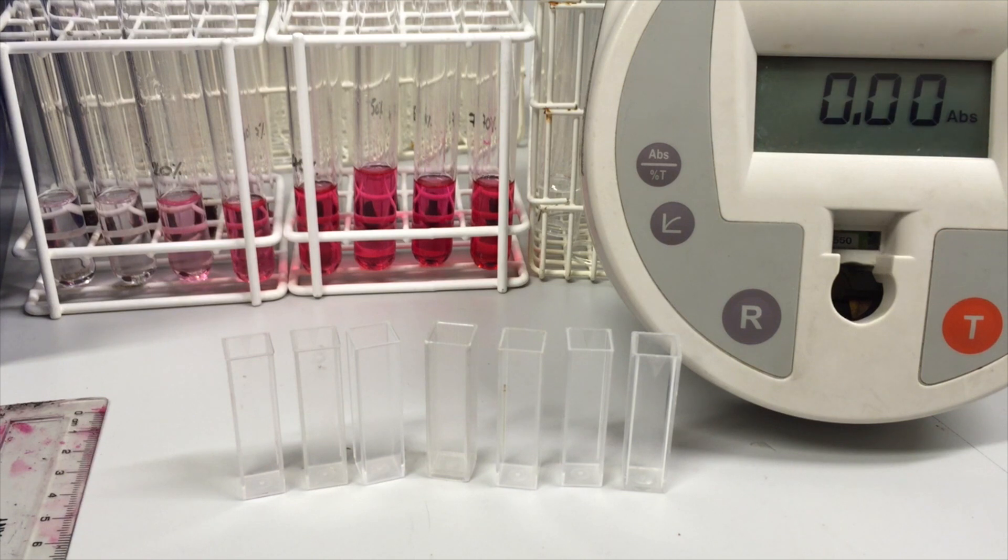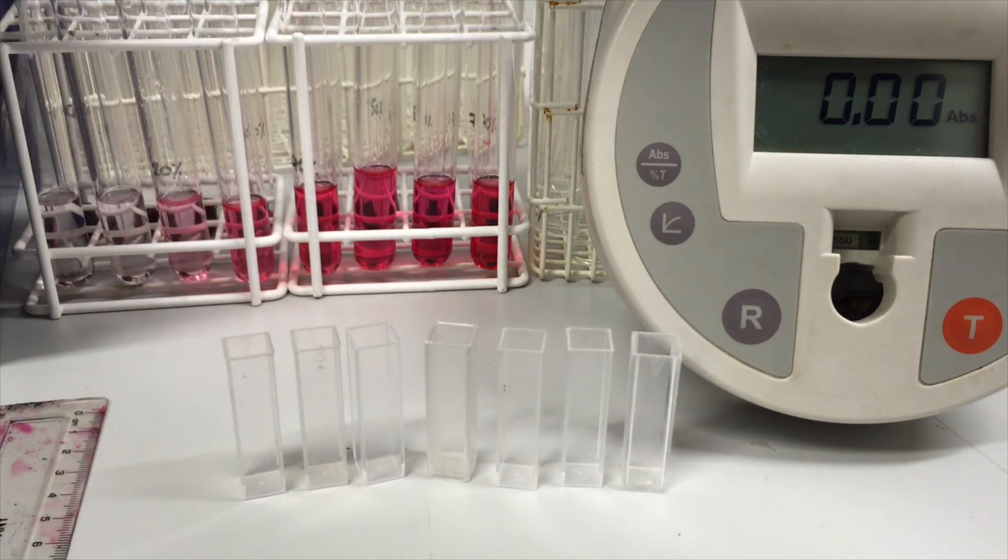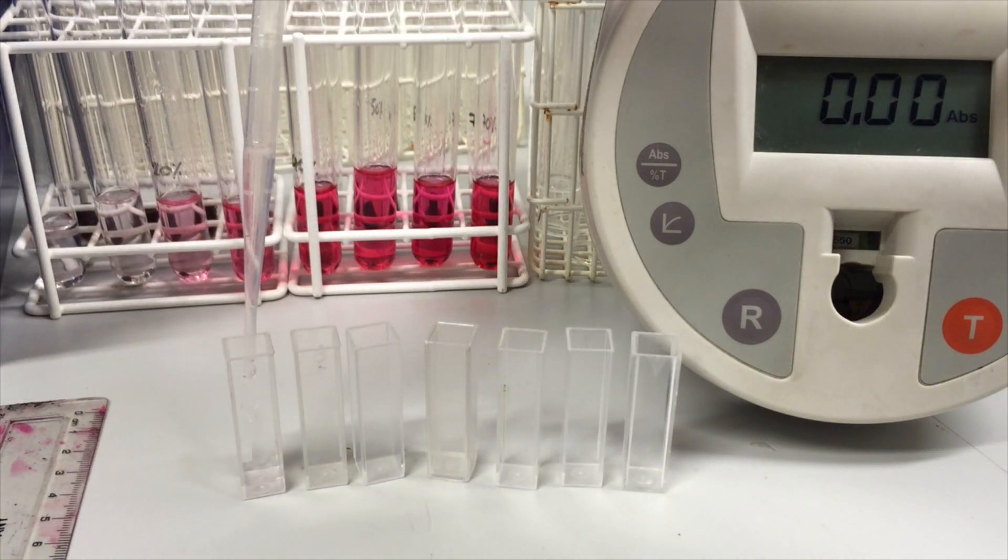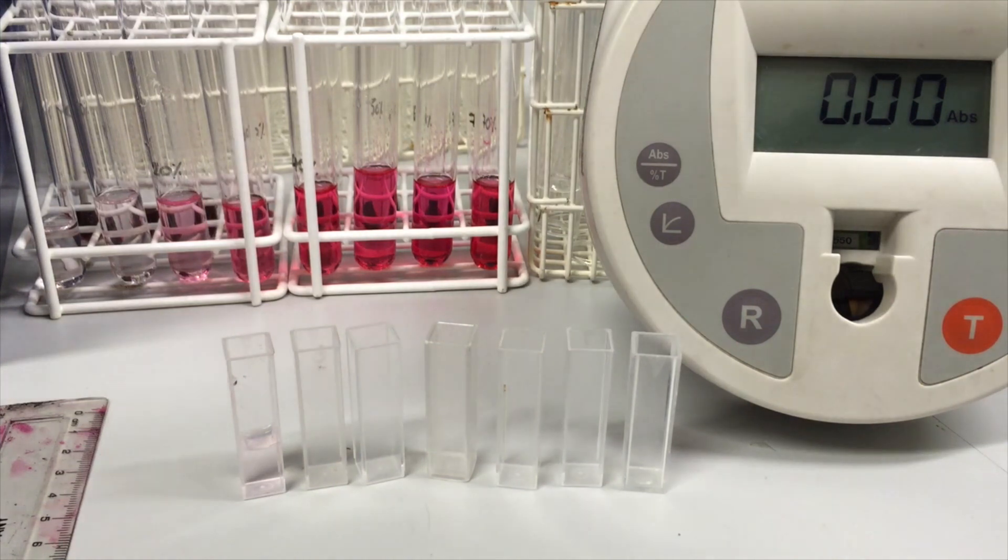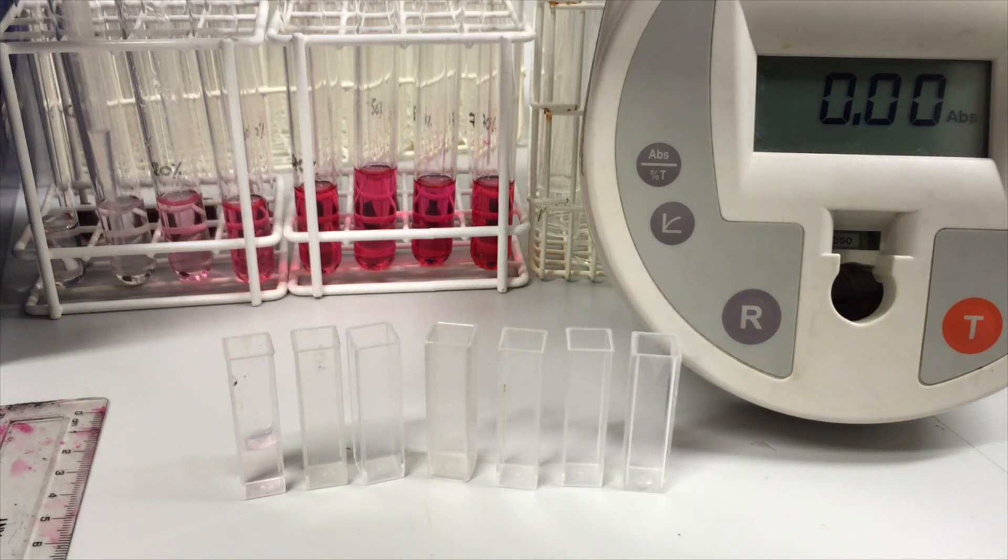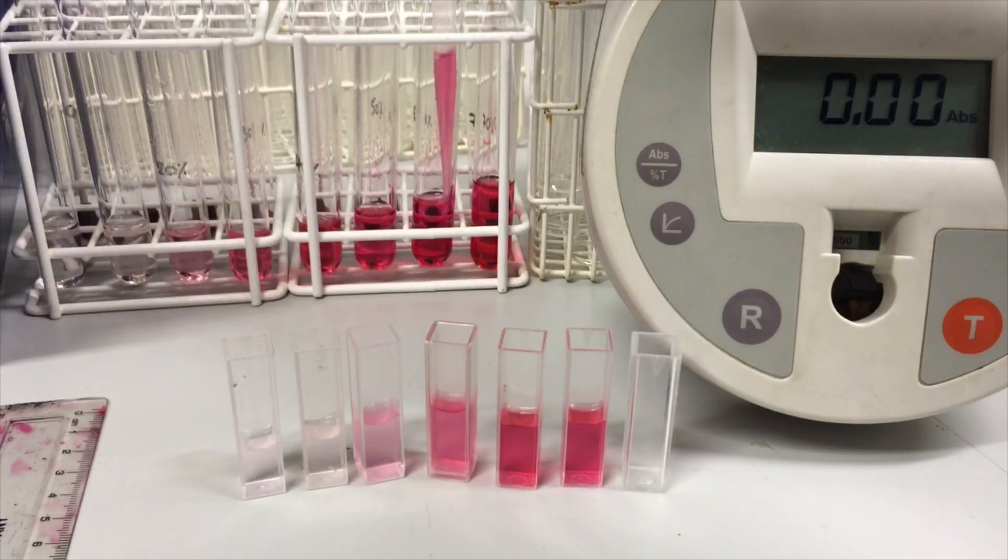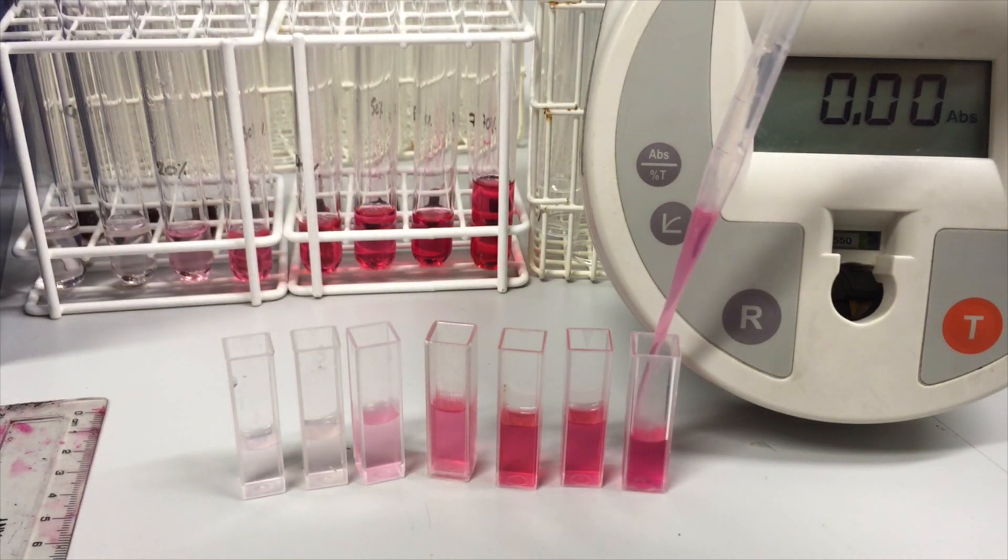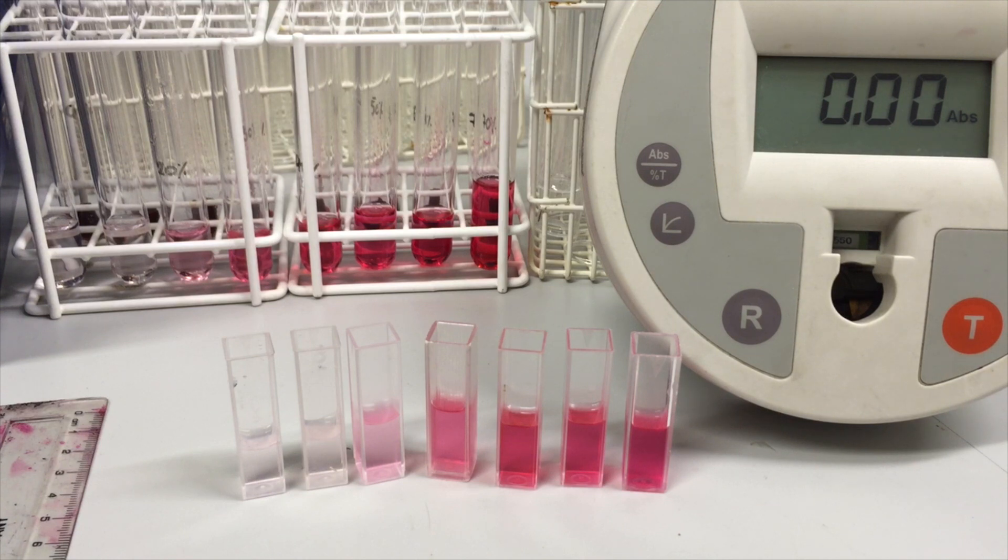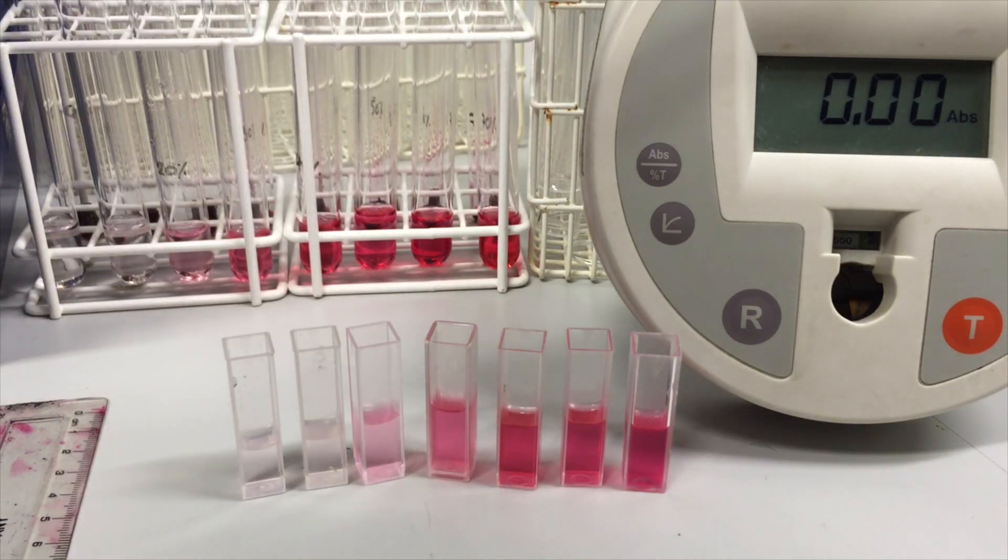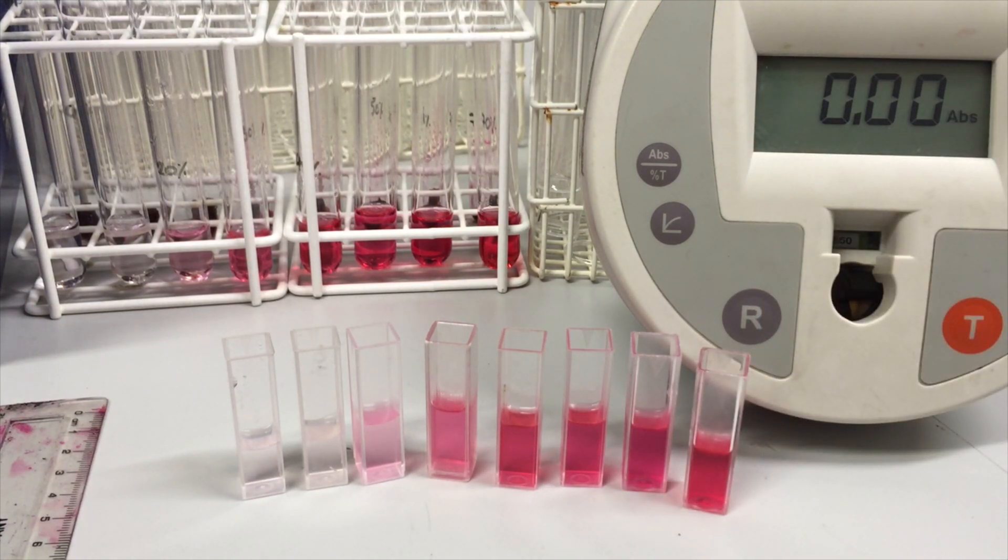Now, next thing we do is prepare our samples in the same way. And what I'll do is just take about two centimeters cubed of this liquid from our tubes and place it in the cuvette. Okay, and we are ready to rock and roll.